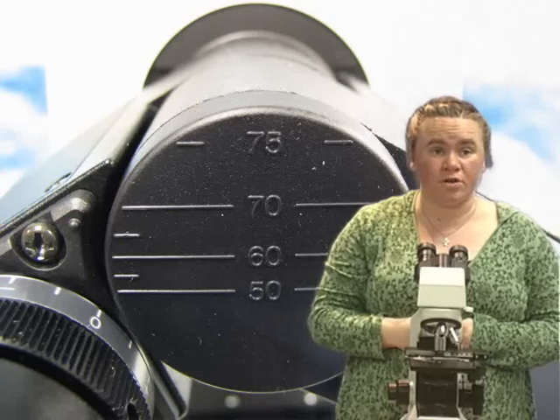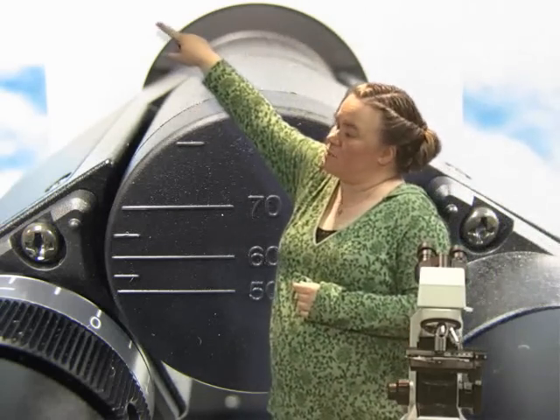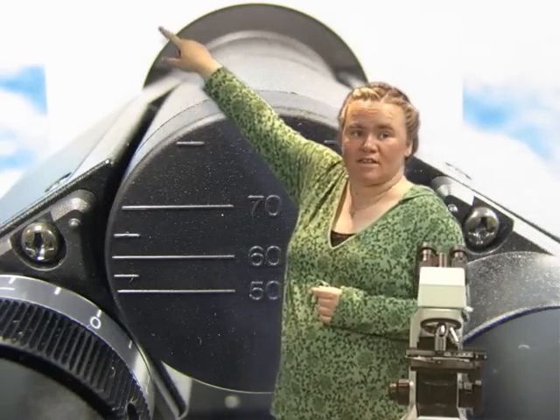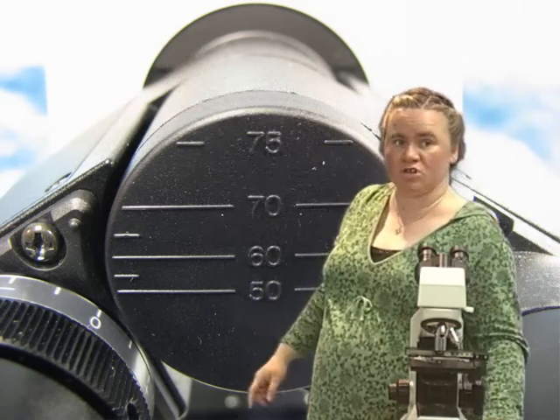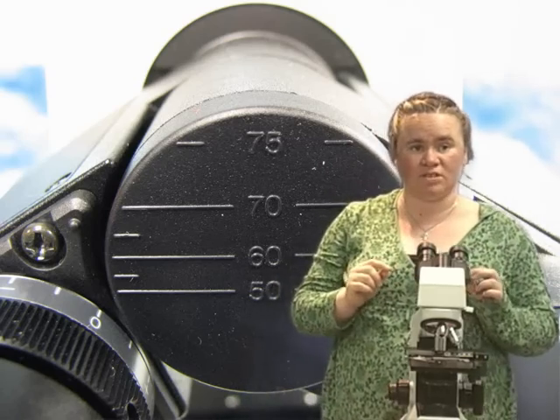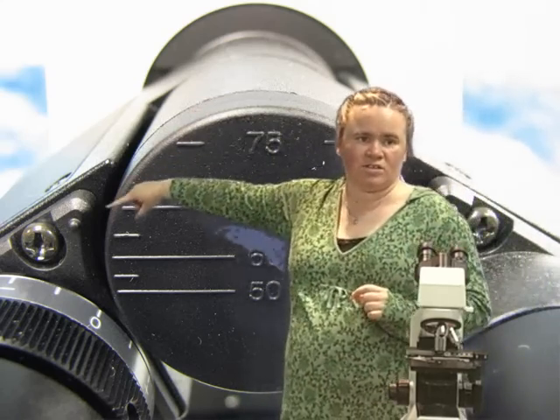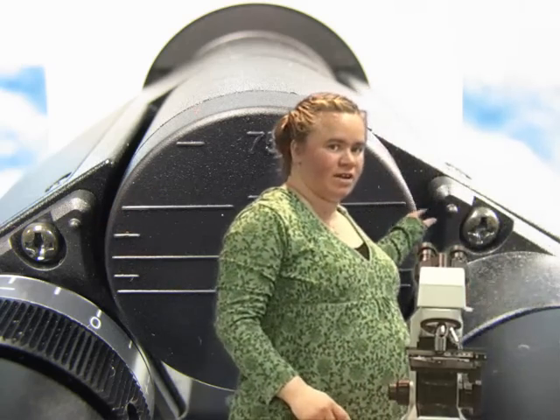you're going to record your interpupillary distance. We're going to look at that circle in between the eyepieces and try to determine what your interpupillary distance is. We do that by looking at two little black dots next to each of the eyepieces — there's one next to each eyepiece. The first one is right here, and the other one is going to be behind me, right here.